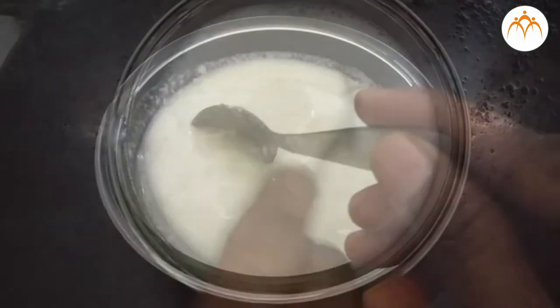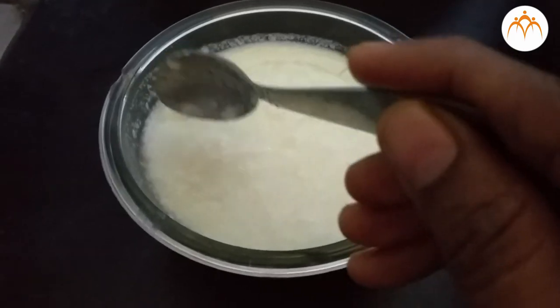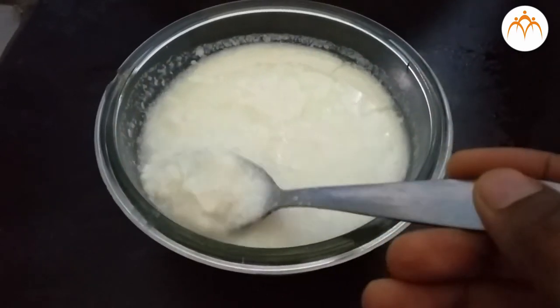Now remove the lid. Observe the consistency, taste, color, and odor of the material. This is yogurt formed.